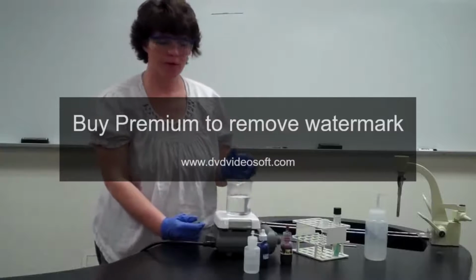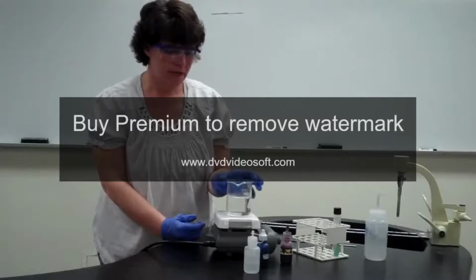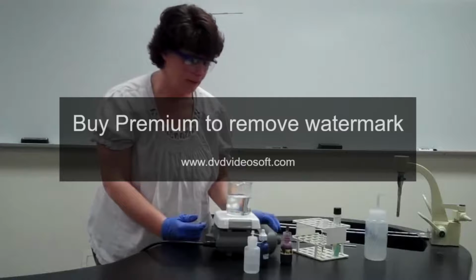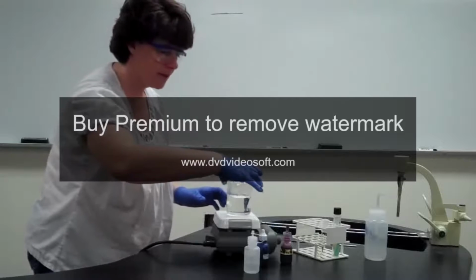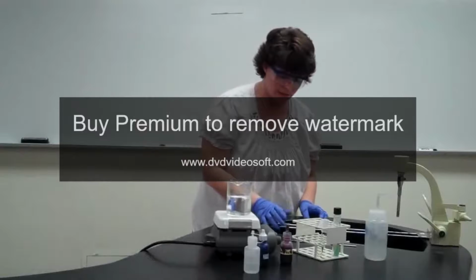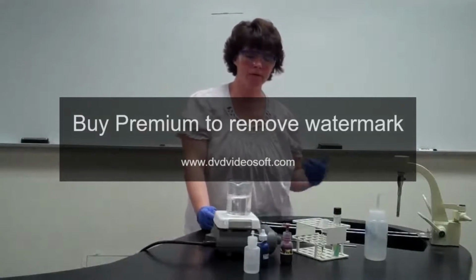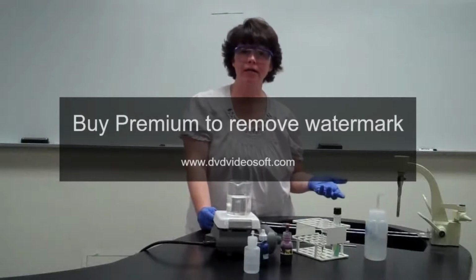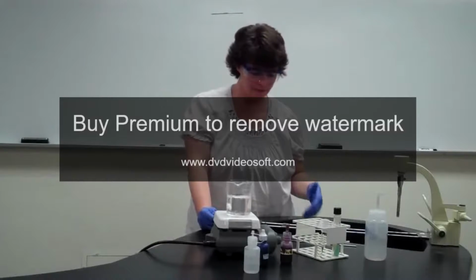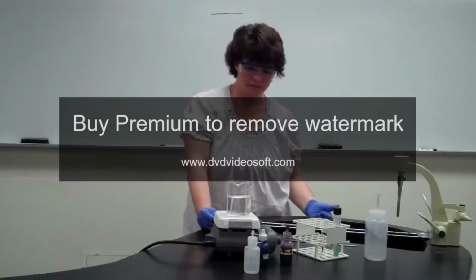So now we'll pretend that our 5 minutes has gone by, and now you want to take the slides off, of course, without burning yourselves. And you can do that by just grabbing the edges and putting them to the side. Okay? Now you're going to take it over to your staining tray. One of the things that we don't want to do is break the slide. And you're probably aware that if you put cold water on hot glass, it's going to break the glass. So we're going to have to let that cool for a minute before we can start rinsing it.